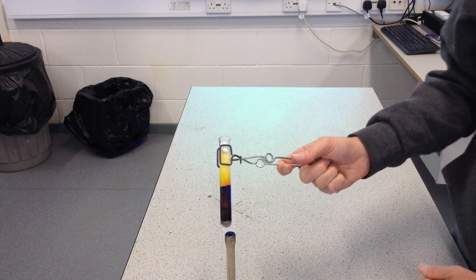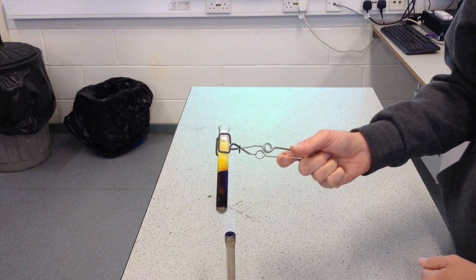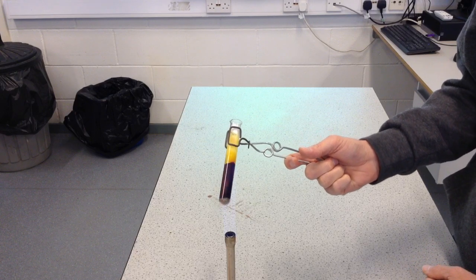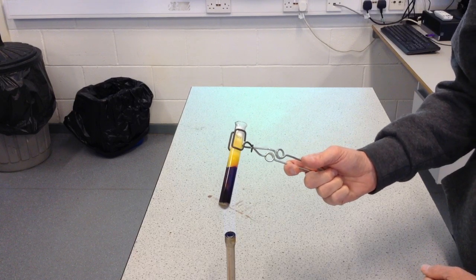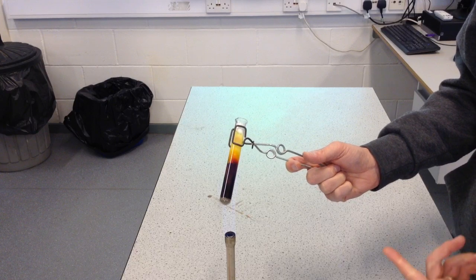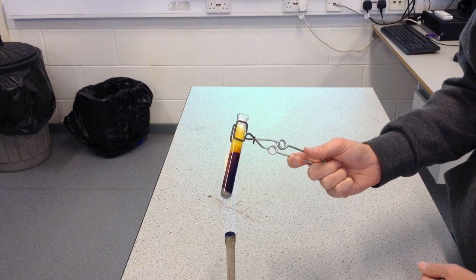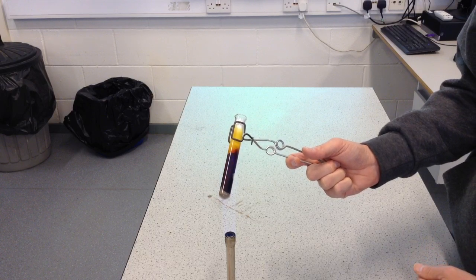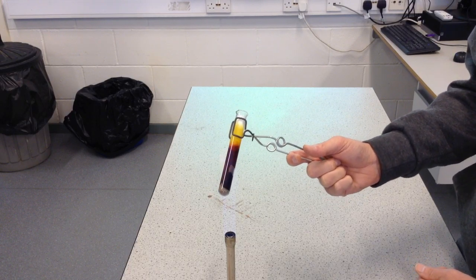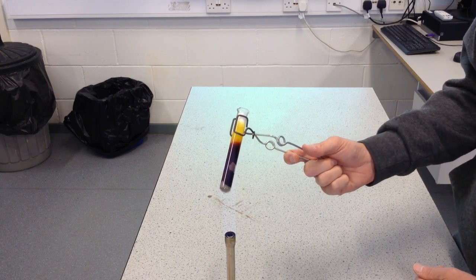We're reacting iron and sulphur together. Hopefully you've been watching the film clips we've made about naming of compounds. The compound we're making here is a two-element compound, so the ending should be in '-ide', and we always put the name of the metal first. So iron and sulphur is going to make iron sulphide, which is the name of this compound.